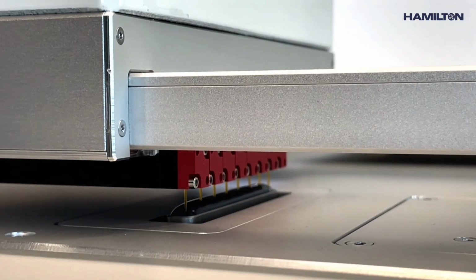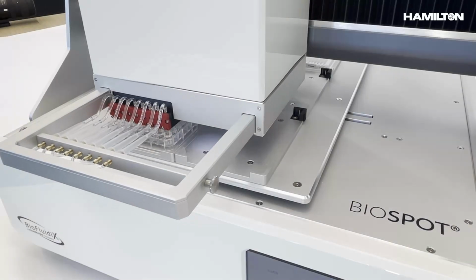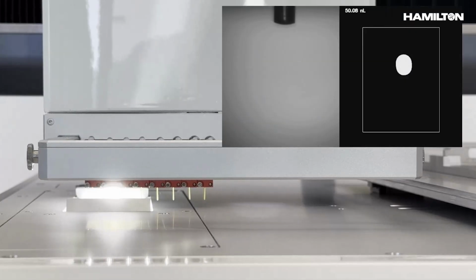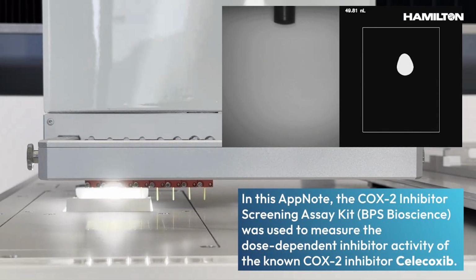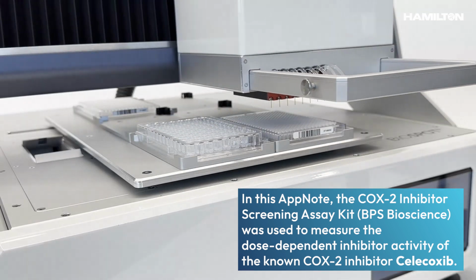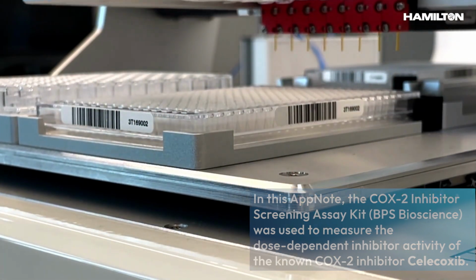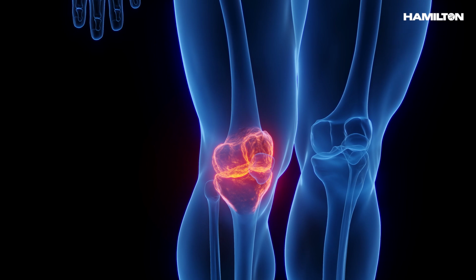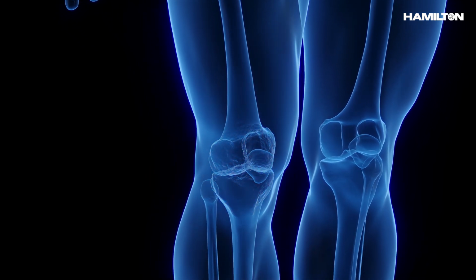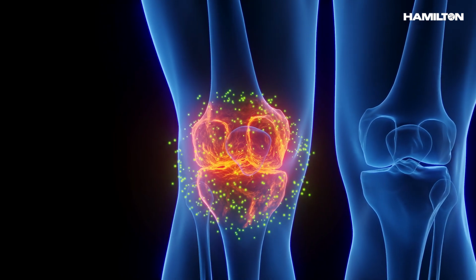Understanding the relationship between compound dose and physiological response is crucial in pharmacology and toxicology. In this app note, the COX-2 inhibitor screening assay kit from BPS Biosciences was used to measure the dose-dependent inhibitory activity of the known COX-2 inhibitor, celecoxib. COX-2 is an enzyme that converts arachidonic acid to prostaglandin H2, which is involved in pain and inflammatory processes.